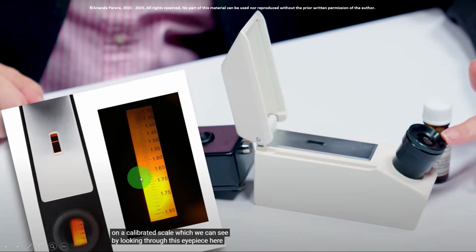Now, can you guess the separating area between the darker and the lighter area? I can see it between 68 and 69.